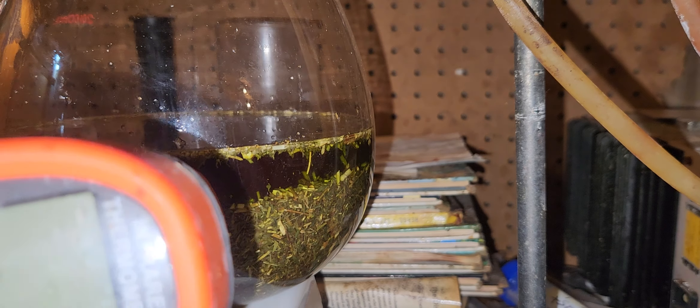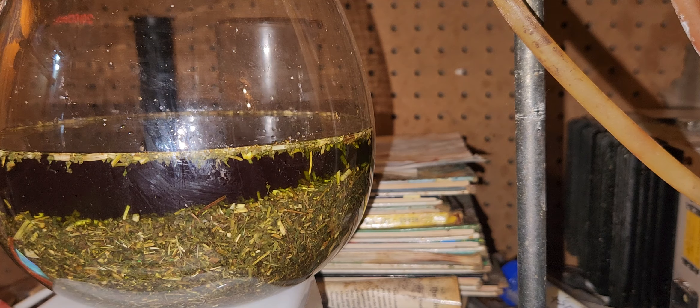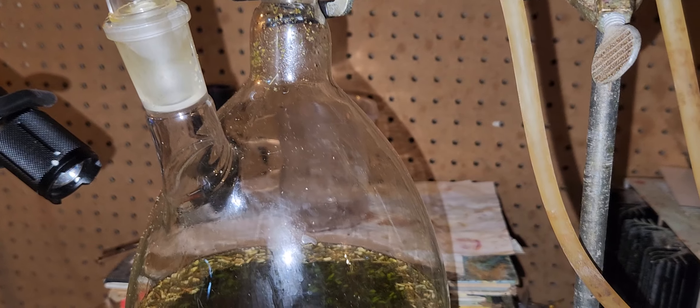If I check the thermometer it's already at 40, 43, 42.3 degrees Celsius — which it's designed — as you can see, steam in there is starting to condense onto it.